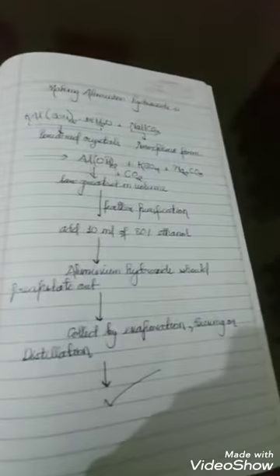Actually, aluminum hydroxide should have a formula Al(OH)3. You get this in the greatest volume and you need not worry about the other things.